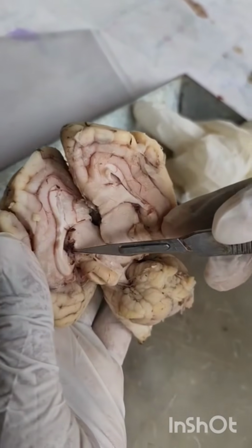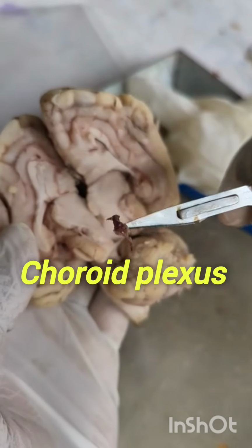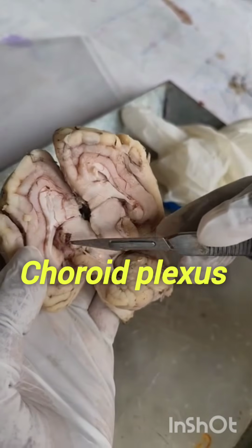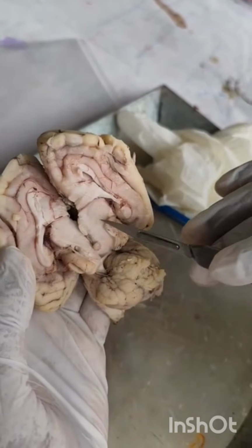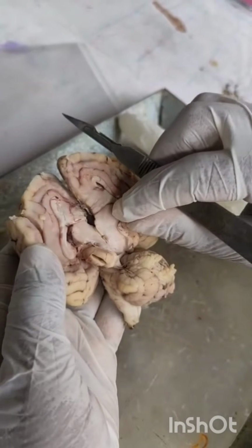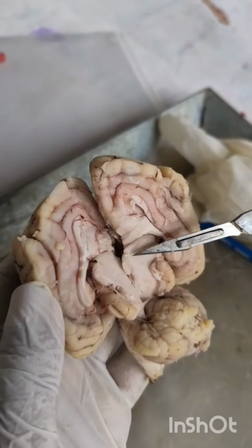And see, this red colored tissue is called choroid plexus. The choroid plexus is present in between the corpus callosum and diencephalon. The choroid plexus secretes the cerebrospinal fluid. The cerebrospinal fluid gives nourishment and protection to the brain.